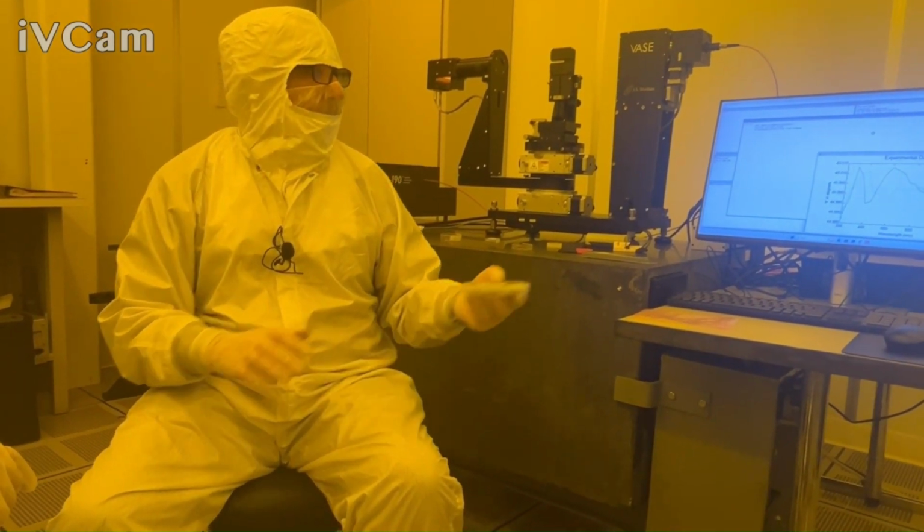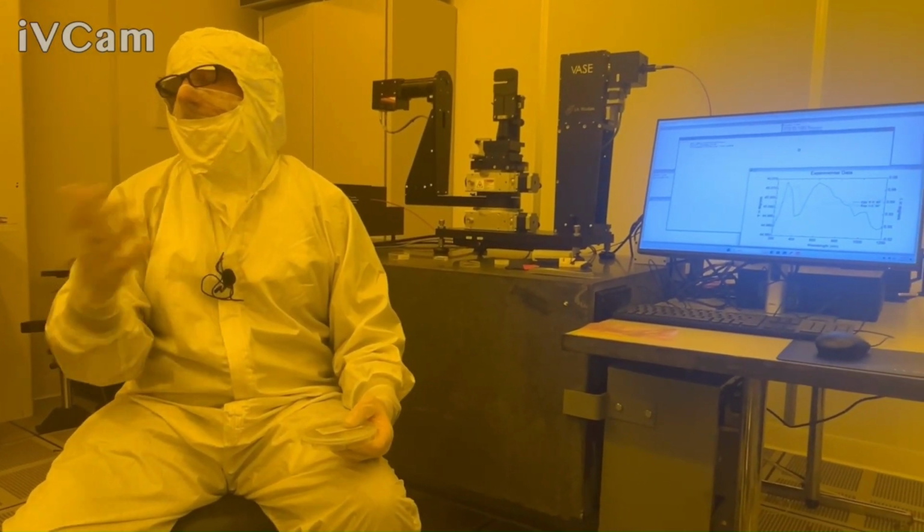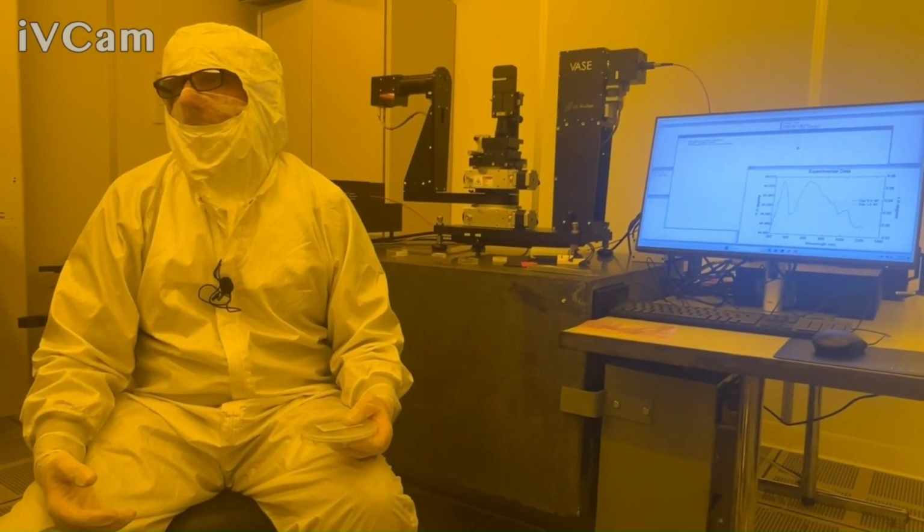That's manifested in the MSE or? That's just manifested in, well, your fit quality. Are you describing the data features? We can look at some of the data and see. Okay.